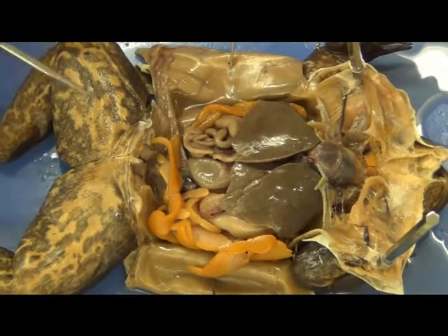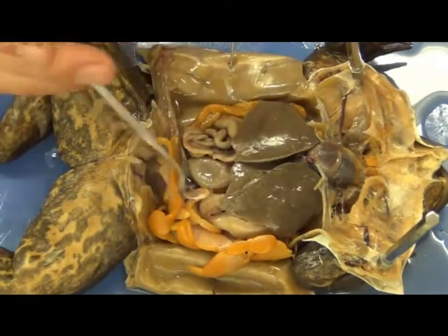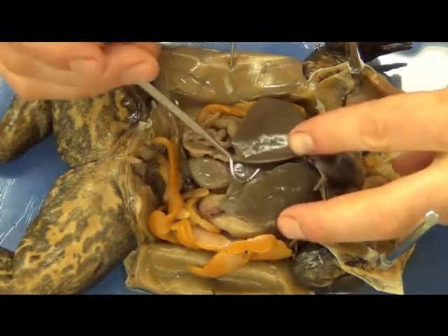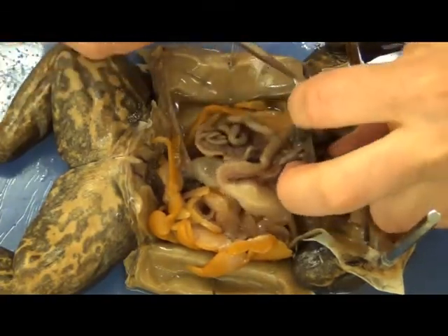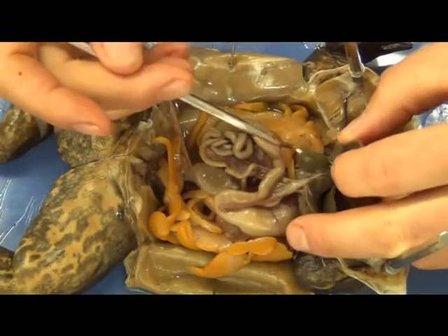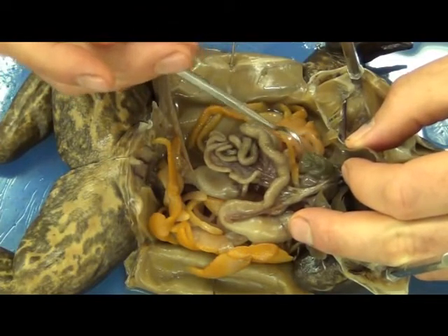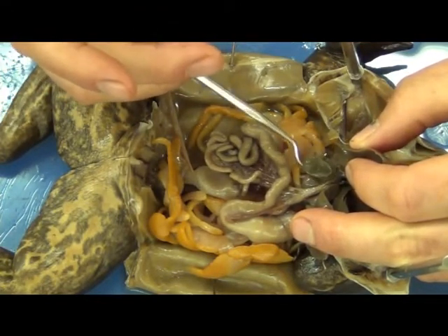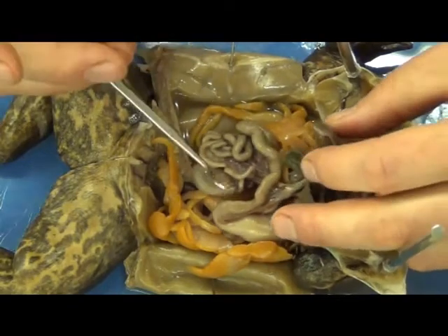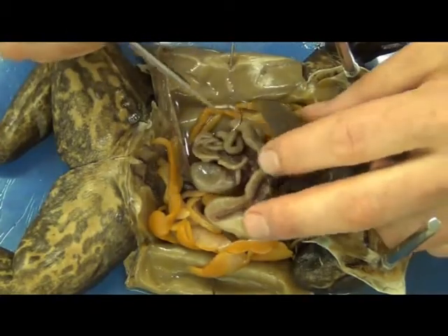Let's look at this guy internally. First and foremost, you'll notice three extremely large lobes pretty much dominating the body cavity — these are the liver. There are three lobes: one, two, and this third one right here. If you look up underneath these lobes, you should find attached or very close in proximity a rather round sac — sometimes it's black, sometimes it's clear, can be empty or full. This one's partially full, and this is the gallbladder, full of bile. We usually have to remove the liver surgically to be able to look at the digestive system.